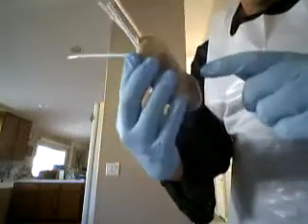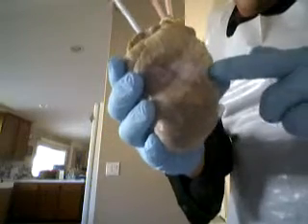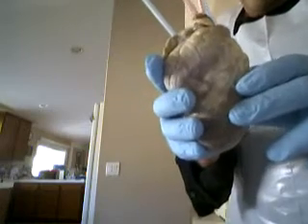Okay. The interventricular sulcus is this area right here, and it runs both anterior and posterior. The ventricles of the heart are separated by two grooves, which are the interventricular sulcuses. Okay. The major blood vessels found in the sulcus are the posterior interventricular artery, the left anterior descending artery, and the anterior interventricular artery.